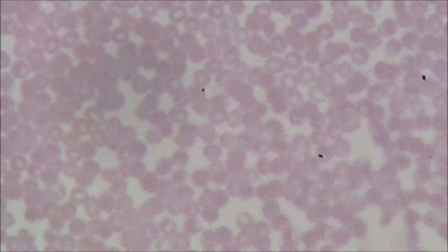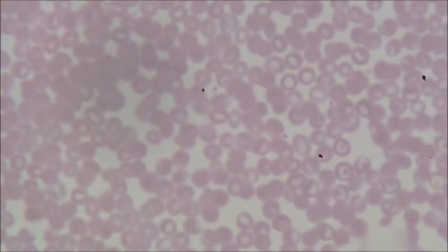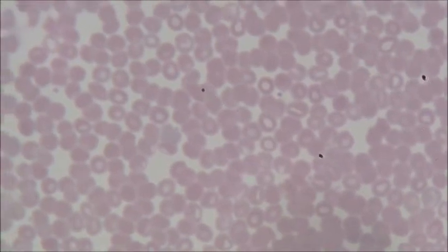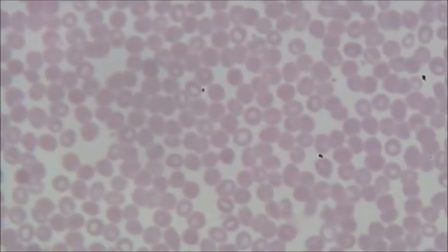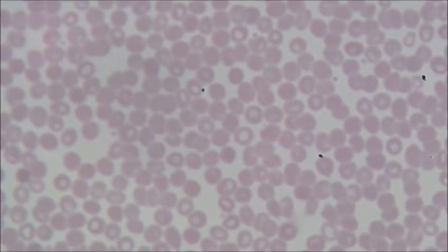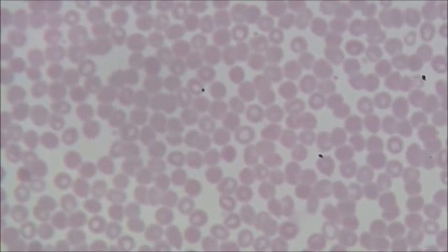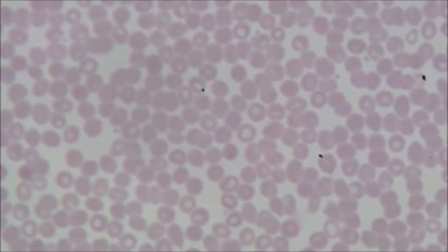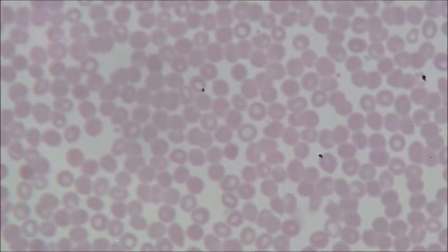I'm just trying to focus it a bit more. No, that's as good as it gets. And we can't really make out any of the organelles. You can see how there's kind of a dot in the middle of some of them, which I don't think is the nucleus. I think that's just showing its shape. You know how red blood cells have that weird round shape with a dent in the middle. But there are some similarities between the human blood and the frog's blood that I think you can notice.